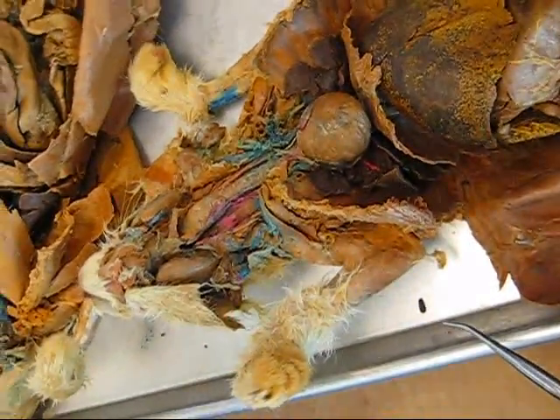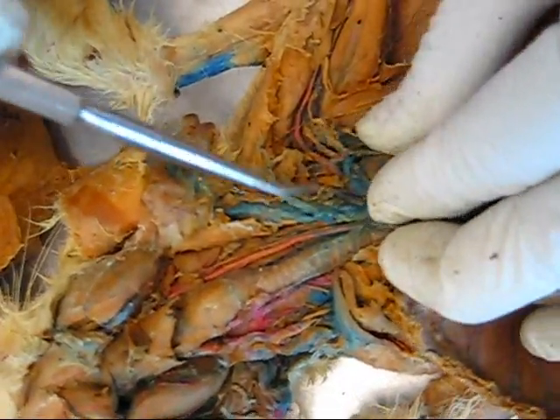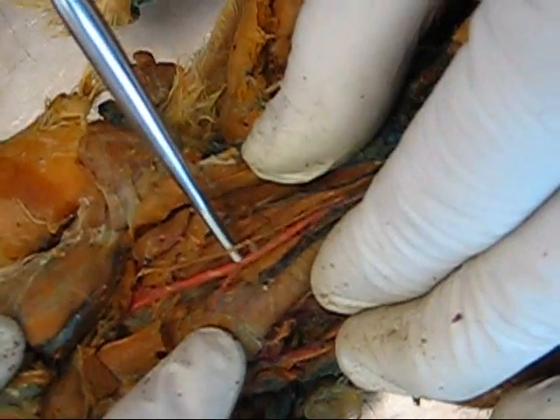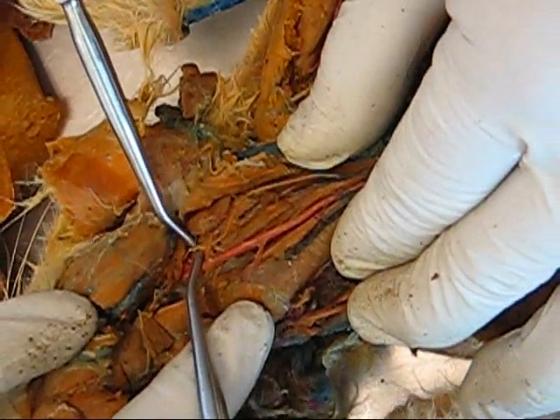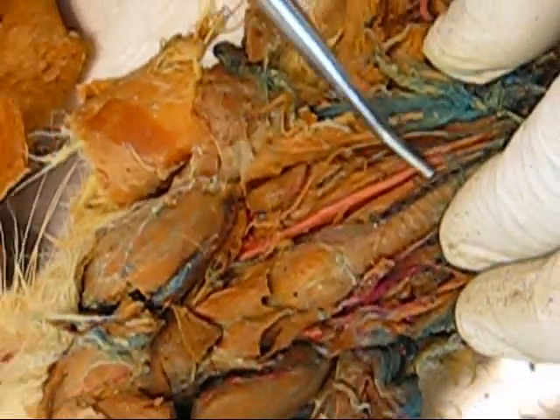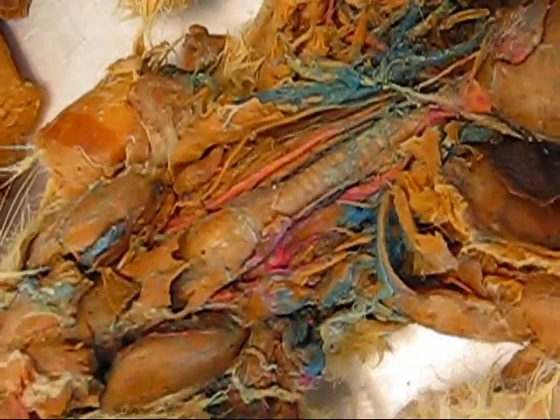Going on to the nervous system. Brachial plexus — this muscle-looking bundle of nerves right here. Nodose ganglion is at the very end of the vagus nerve, which is this one right here. Anterior cervical ganglion is missing on this rabbit, but it should be anterior to the nodose ganglion — it's the end of the sympathetic trunk, a very tiny nerve, tinier than the vagus nerve. Vagosympathetic trunk — the vagus and the sympathetic trunk as they run up the neck together.